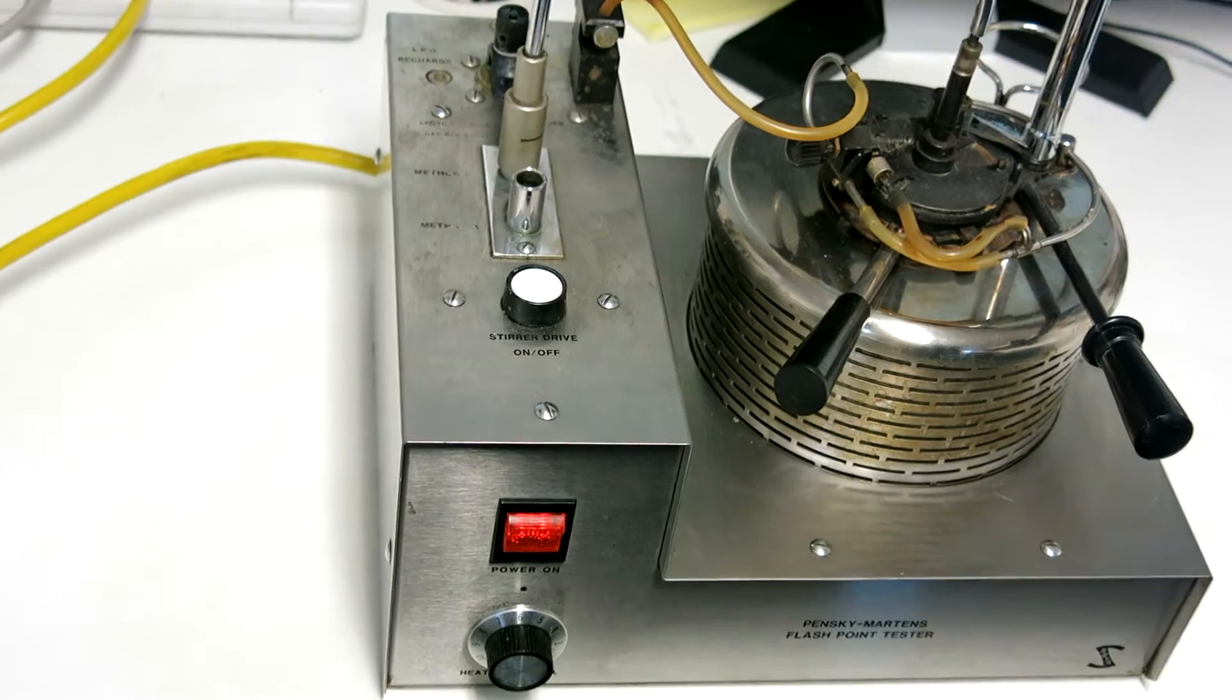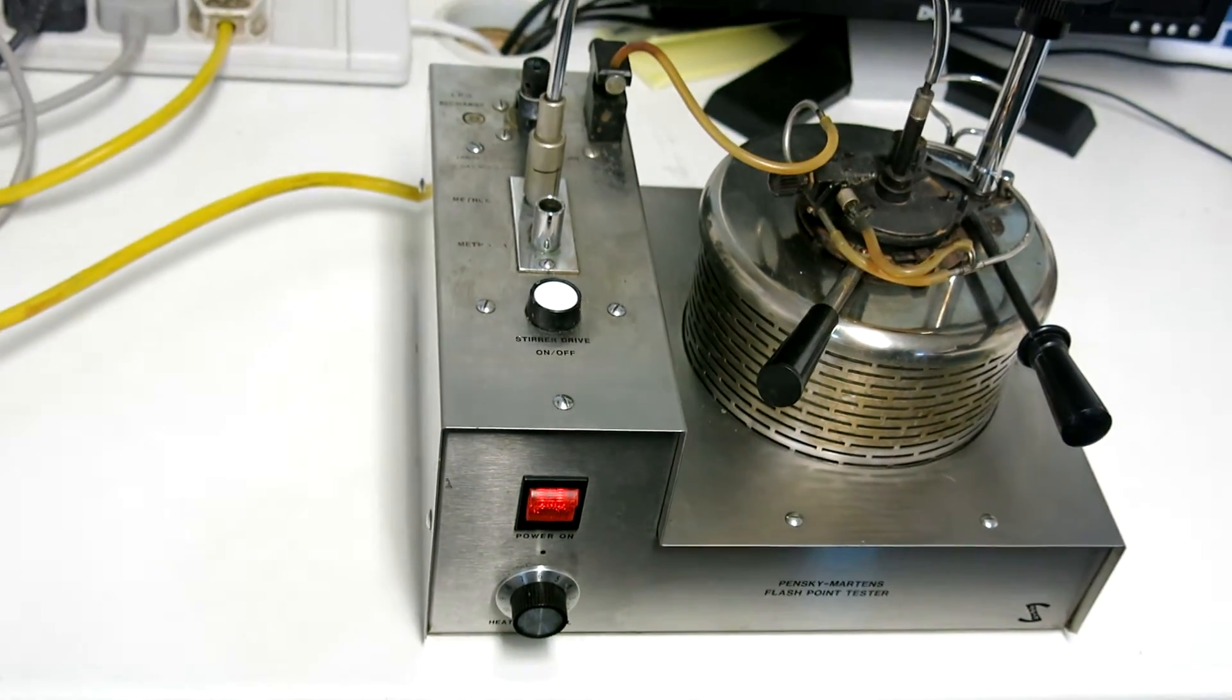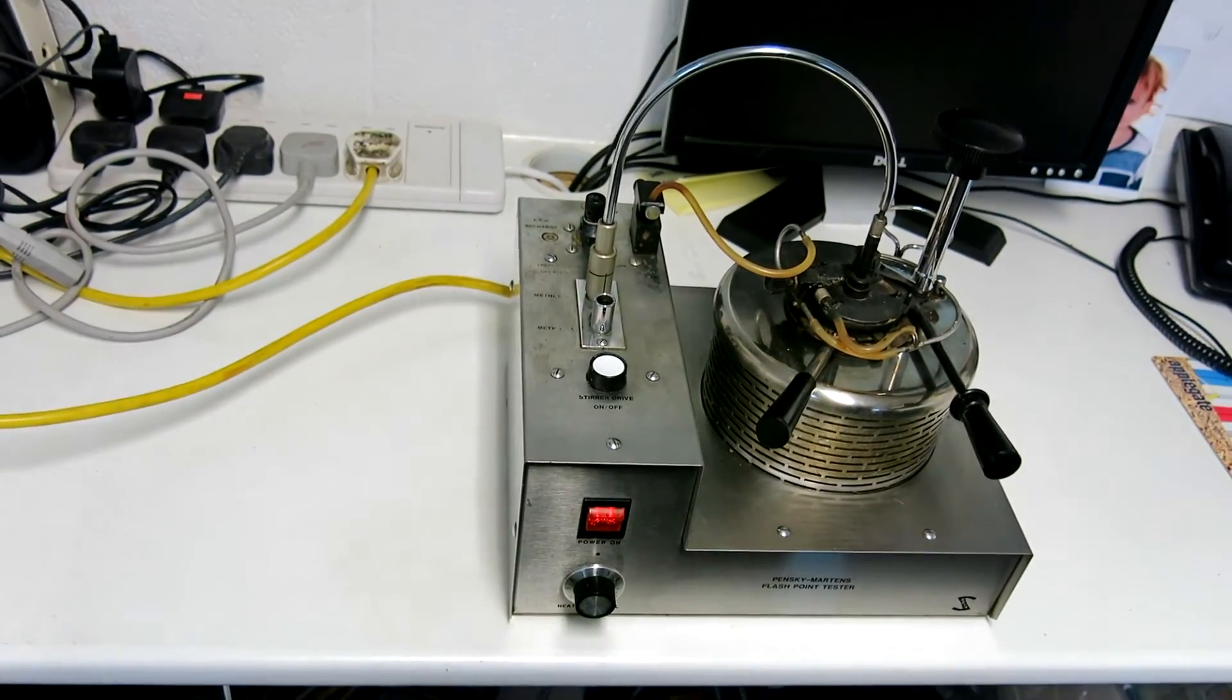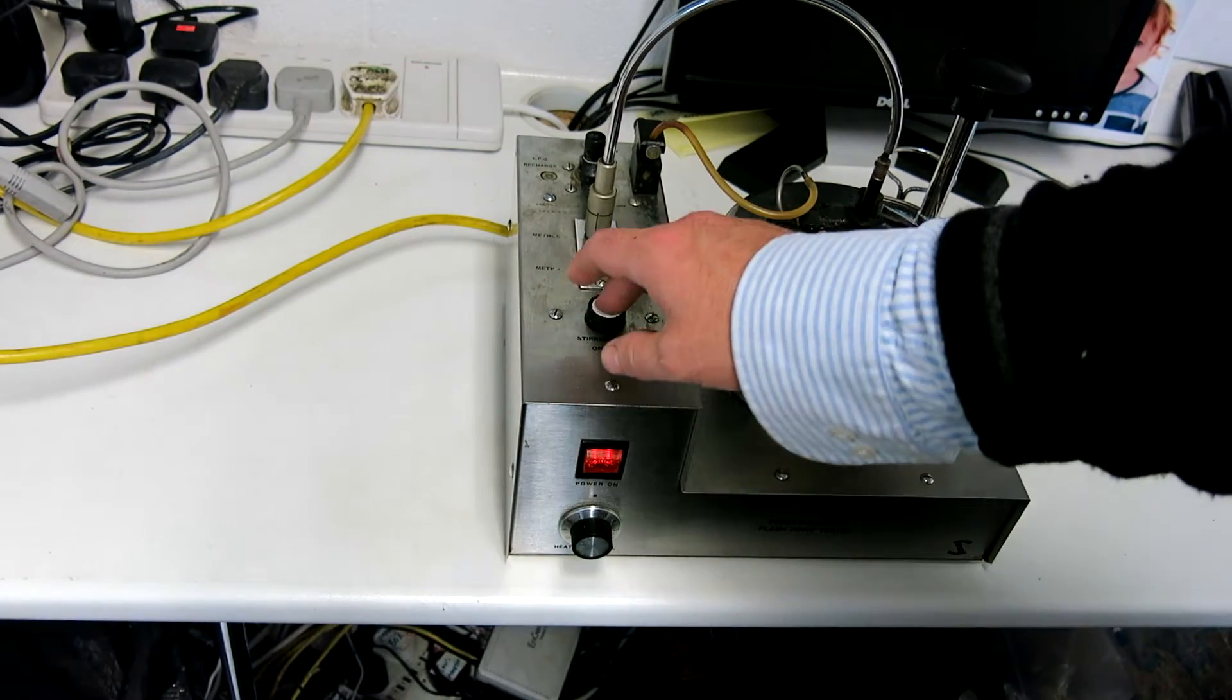I'll just zoom out a little bit here. Hopefully you can see that fairly clearly there in terms of the speed. So we'll turn the speed off.